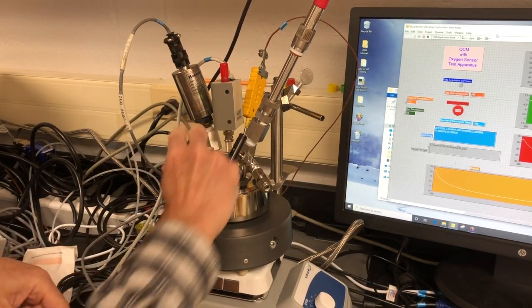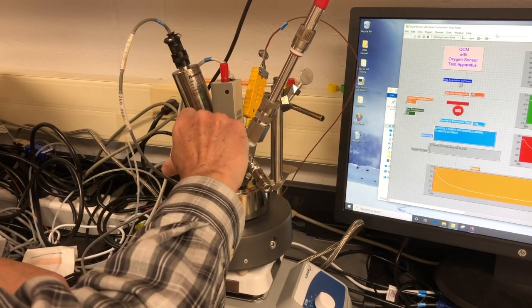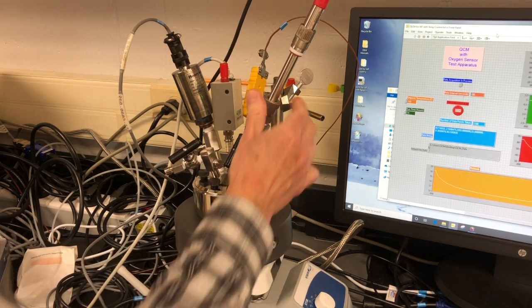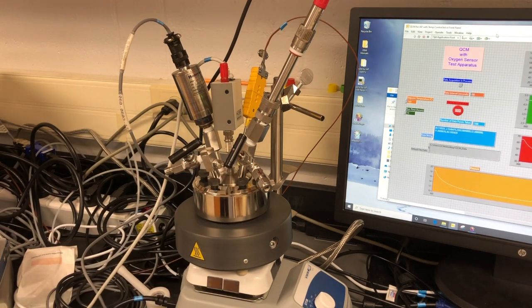Now tighten the inlet and outlet gas fittings. The reactor is now ready for the next run.